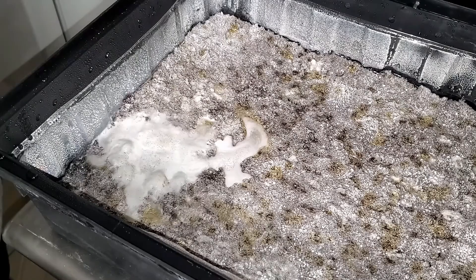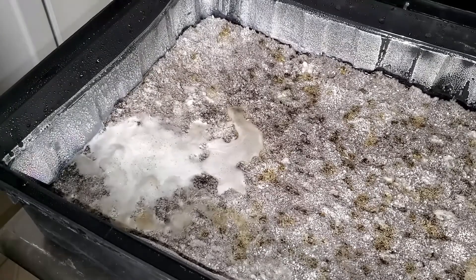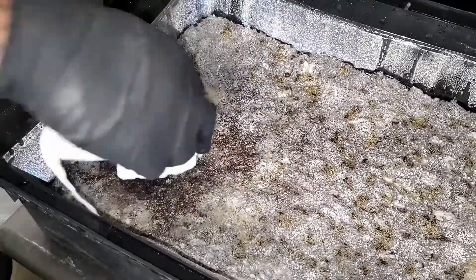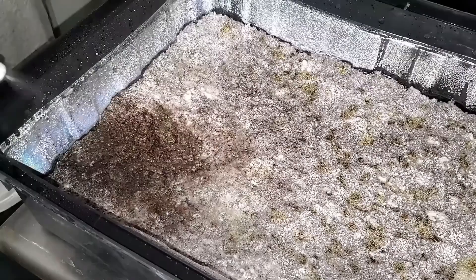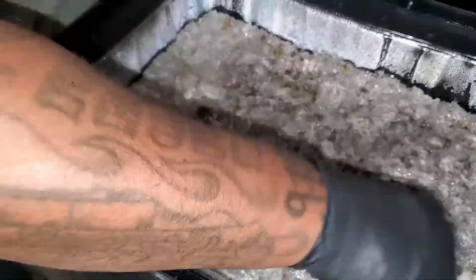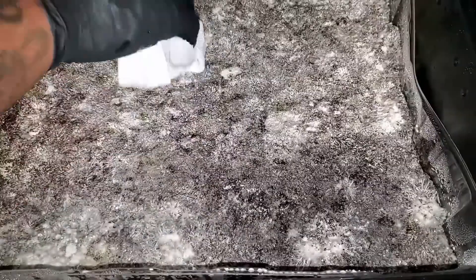According to Google and YouTube, as you spray it the hydrogen peroxide actually breaks up the contamination. Seeing the reaction happen, I was thinking about whether just leaving it on there would work, so I took some clean paper towels and got all that stuff up. That's basically all I'm doing — just taking a couple paper towels and getting that up. Then I spray it again, because if I missed anything I'll see the reaction once more and can clean it up again. I pretty much got the contamination cleaned up using more clean paper towels.